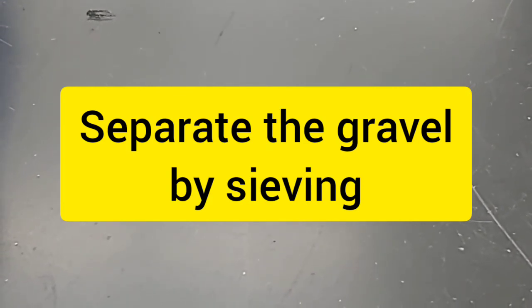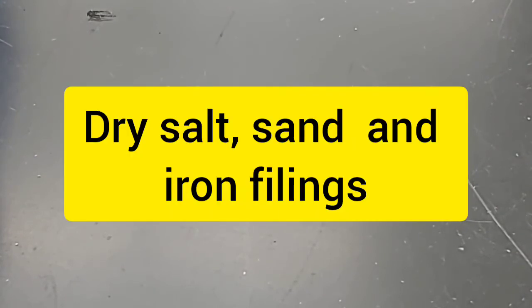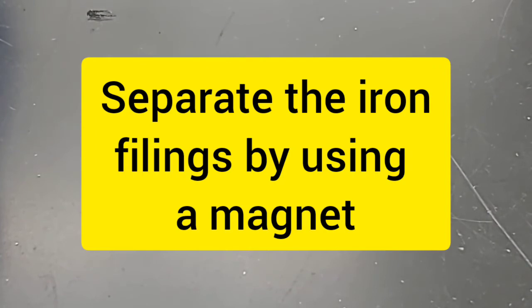And then we're going to separate the gravel using a sieve. And then after that we have dry salt, sand, and iron filings. So the next thing we are going to separate is the iron filings by using a magnet. So you have now dry salt and sand.